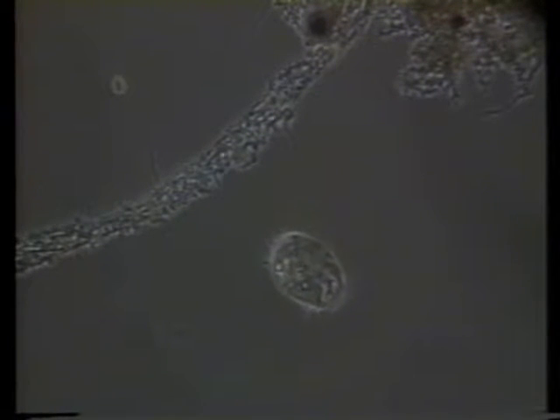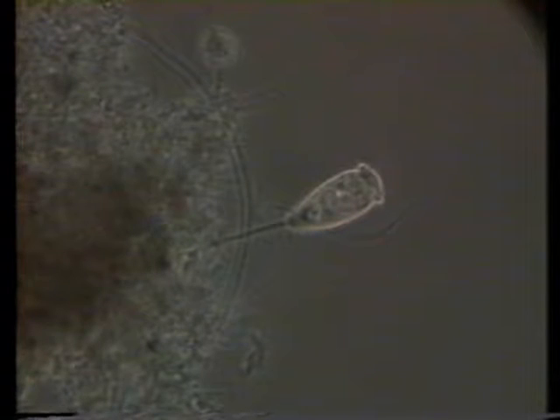The third group of protozoans, ciliates, are characterized by little hair-like projections called cilia. The cilia cover all or part of their body surface. They're commonly found in two forms, free-swimming and stalked. Free-swimming ciliates are round or oblong and move in a smooth gliding fashion. They're commonly found when there's an abundance of bacteria. A predominance of free-swimming ciliates usually indicates good treatment.